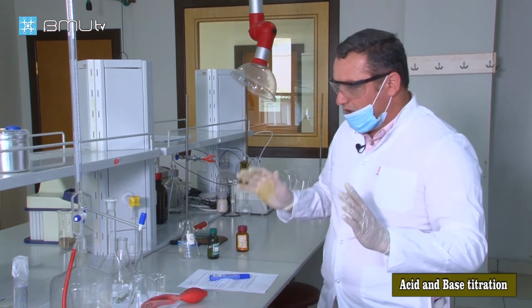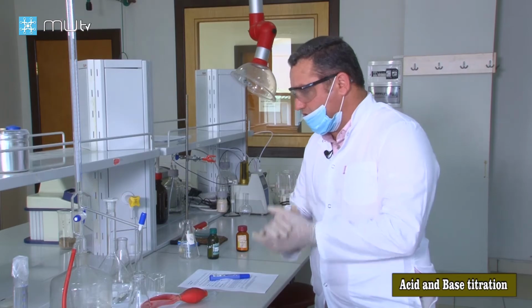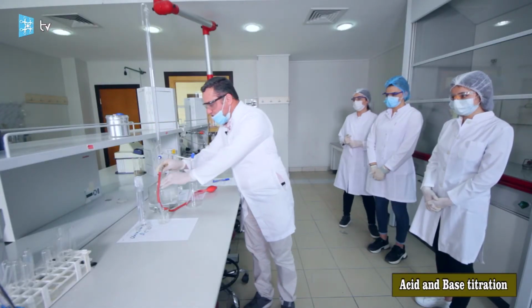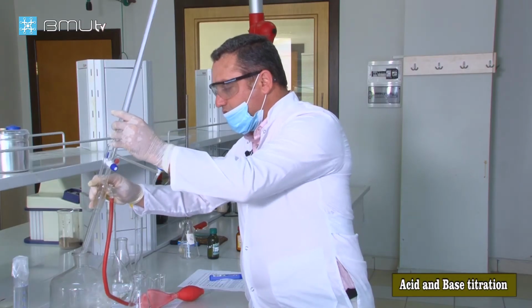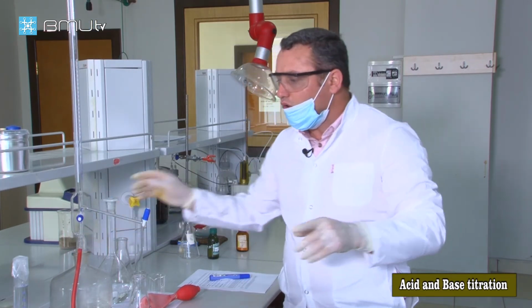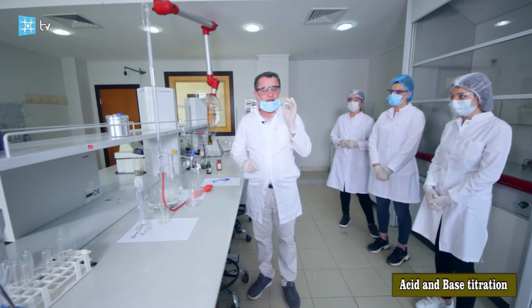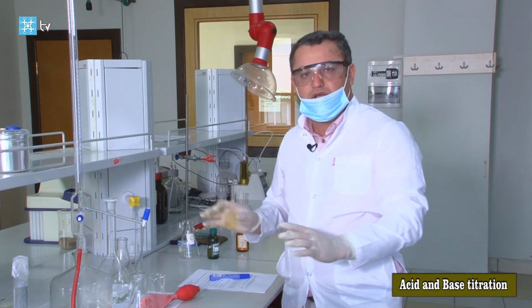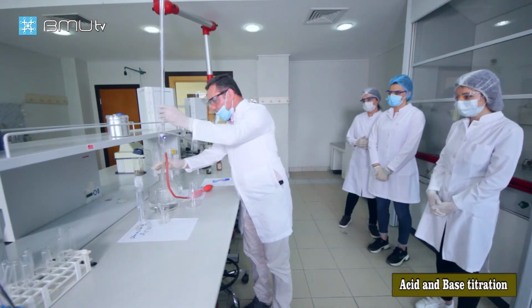Now, for our experiment, we need to start our reaction, and this is our burette. We must add our standard solution to our burette. Before the reaction, I want to mention that all of the equipment should be clean and dry. I repeat again, all of the equipment should be clean and dry.